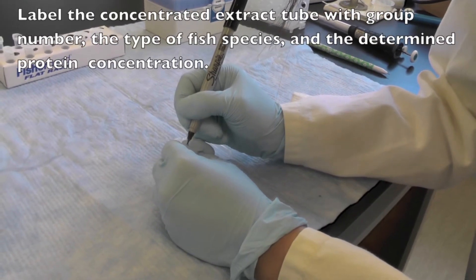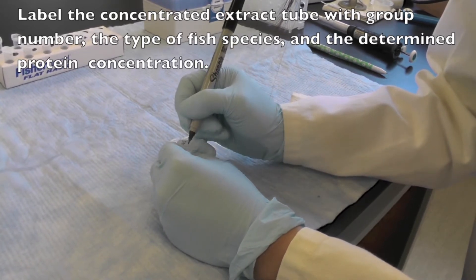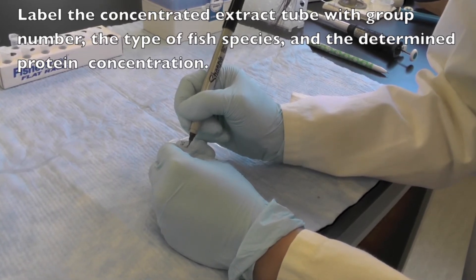Label the concentrated sample extract tube with your group number, fish species, and the determined protein concentration in mg per mL.